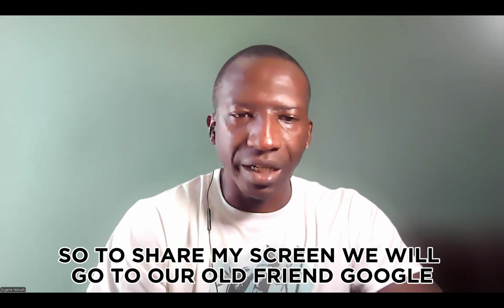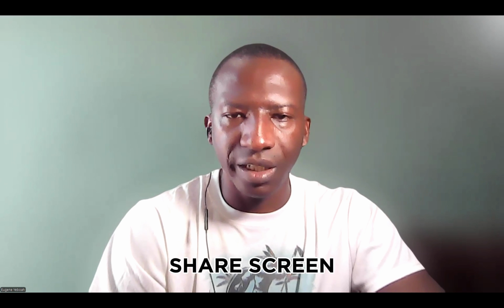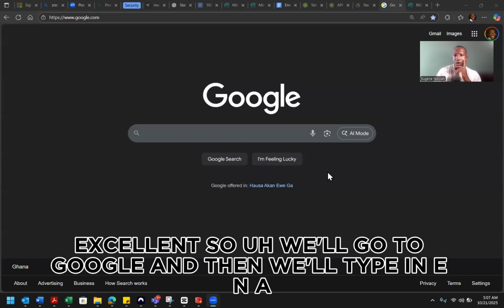So to share my screen, we will go to our old friend, Google. Let's go share screen. Excellent. So we'll go to Google and then we'll type in ENA.